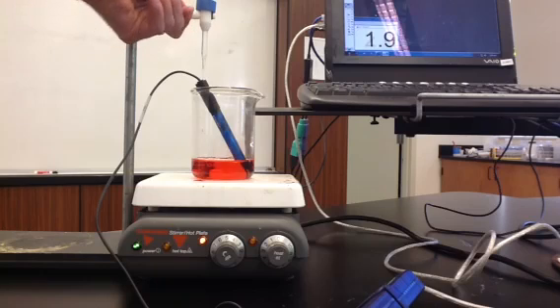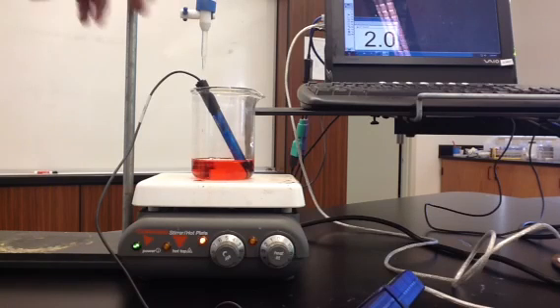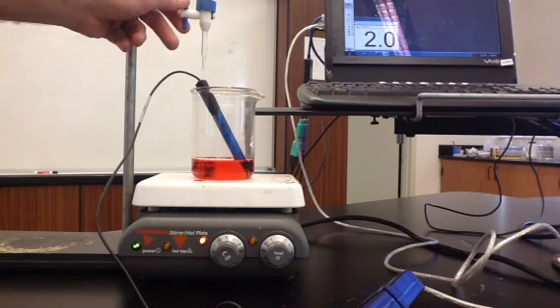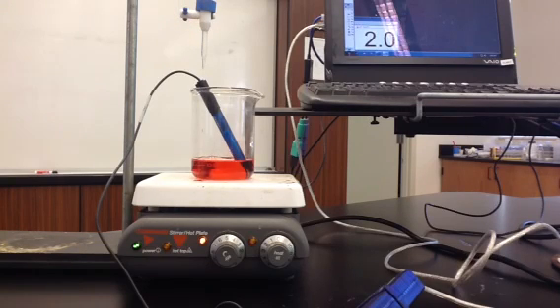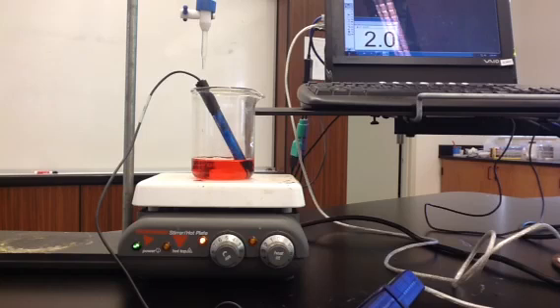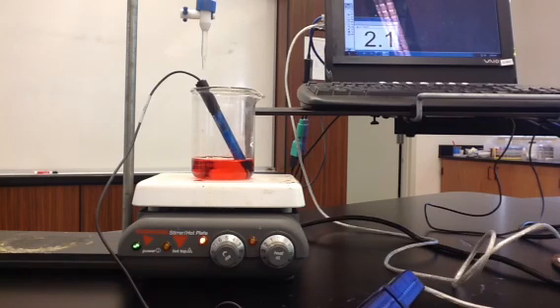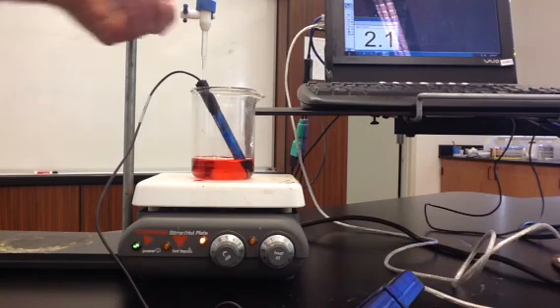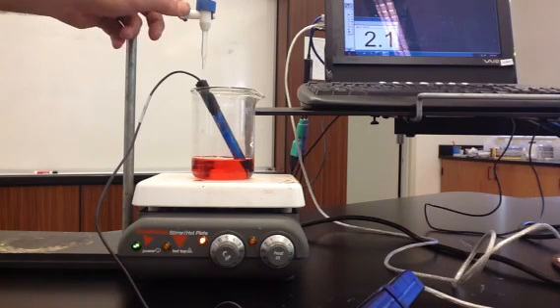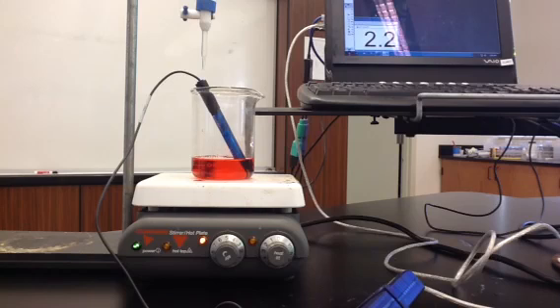This is our fourth milliliter. So we've added four milliliters — we just saw a small change in the pH. The pH is now 2. So after adding four milliliters of the base, we're at a pH of 2. That's five milliliters of base. Six milliliters. Seven. Eight. Nine. Ten. Eleven milliliters of base have been added. Our pH is now 2.2.